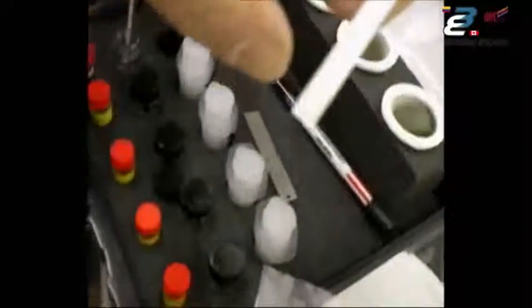While the titration tube is wicking up, you can perform the nitrate test. There are five individual tests in this package on a perforated tear-apart seam. Tear one off — it says 'open' on this end; hold it a little below the top and tear it off. The little pad at the bottom is what tests the nitrates. Following the directions on the package: dip the test strip into the extract sample for two seconds, remove it, wait one minute, and match the color change. Use the second hand on your watch and wait the full minute.